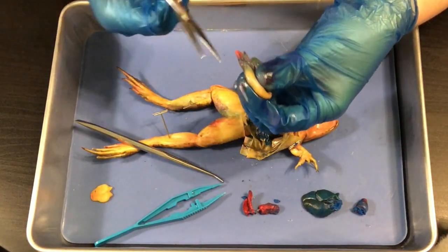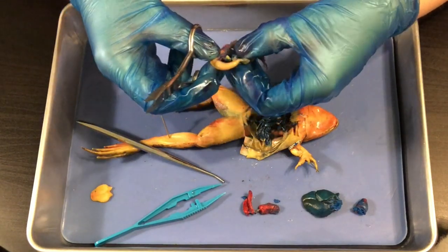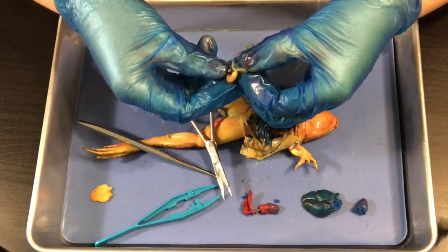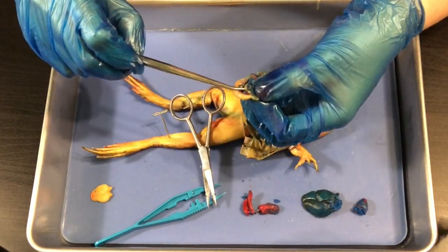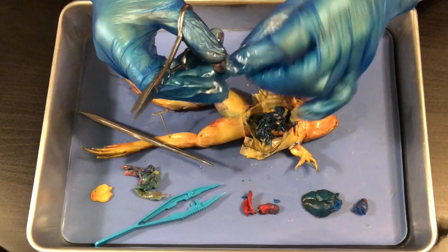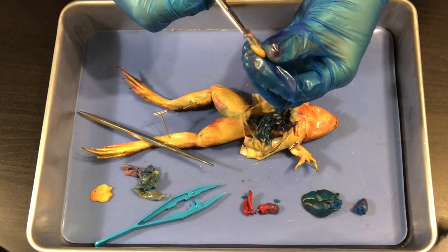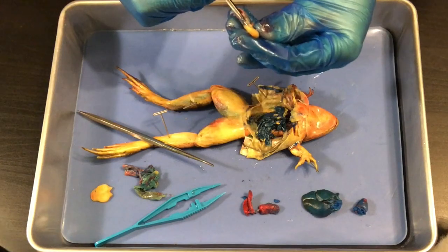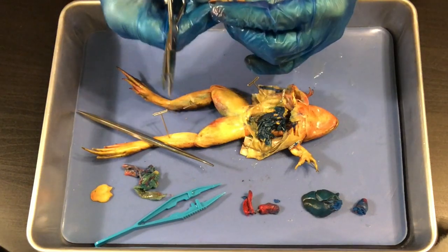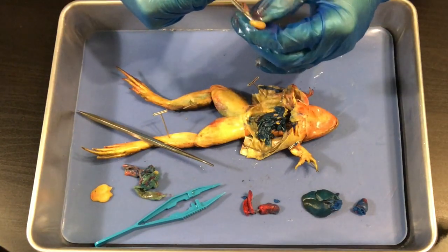I'm going to pause and open up the stomach, which you will do if you have enough time. I'm going to cut it off to separate out the stomach. In here you can also find what I believe is the pancreas — it looks like a little stringy structure. For the stomach, what I think is easiest is to stick my scissors into it and then cut it open like a book. I'm really hoping there's something in here — some of your stomachs will be really big and full of things, and others will not.